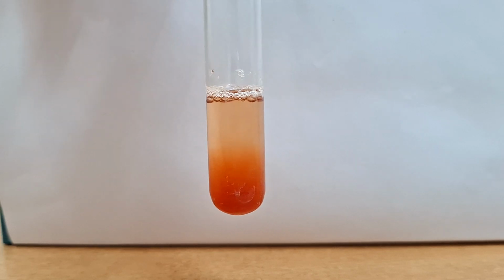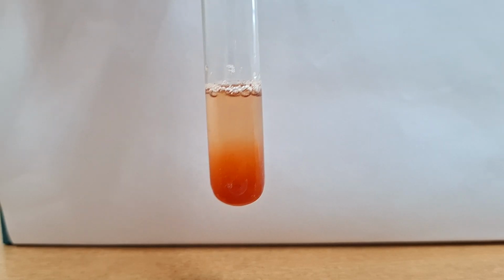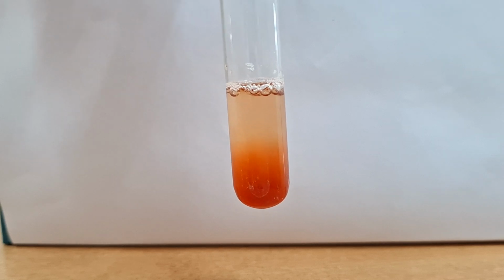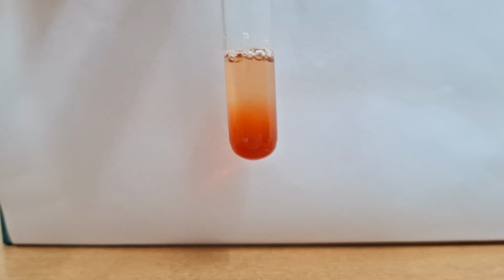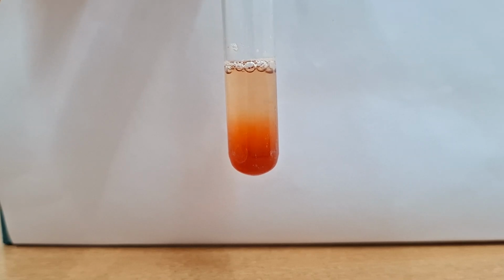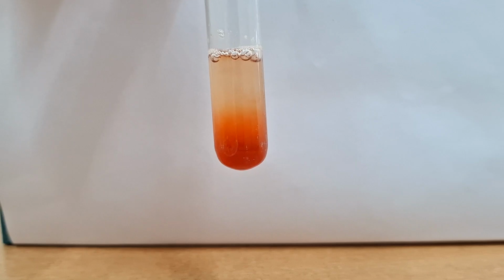The principle of this test is: in alkaline medium, alpha naphthol combines with the guanidine group of arginine to form a complex, and this complex is oxidized by our oxidizing agent sodium hypochlorite to form a bright red color complex. You can see the very bright red color complex on the white background, and this test is Sakaguchi's test. This test is positive. Remember, we can keep this test in your spotting examination, so all of you must understand this test.